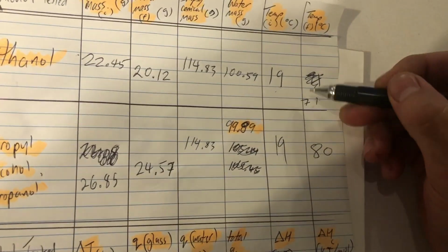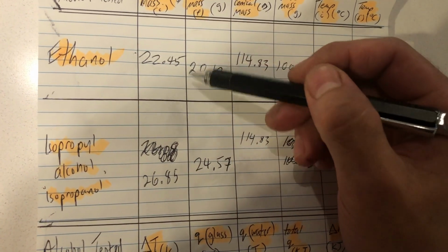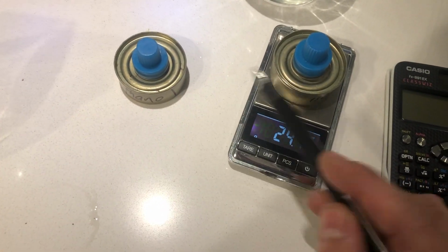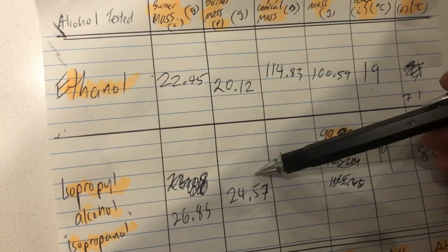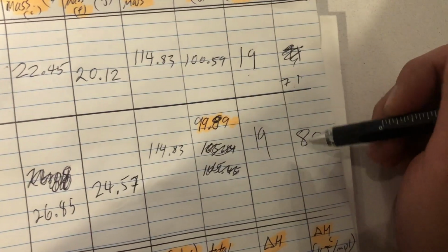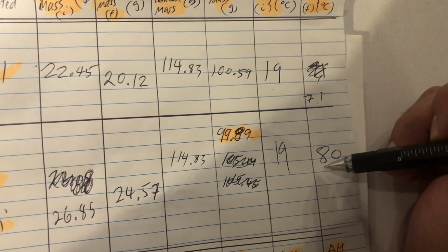So you'll notice it did get hotter. You'll notice it burnt roughly still 2 grams of fuel, so about the same amount. The burn rate is about the same as you'd expect, same size opening, same amount of airflow available. So it's burning the fuel about the same speed, although this one might be a little bit different due to stoichiometry being slightly different. However, we got a lot hotter this time around.